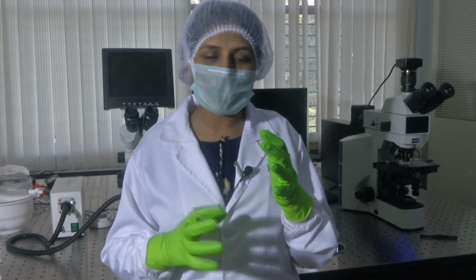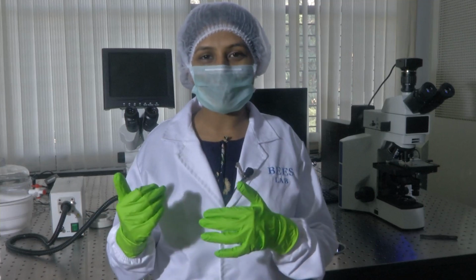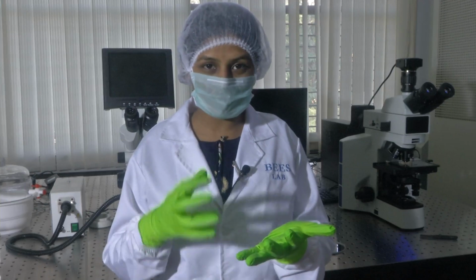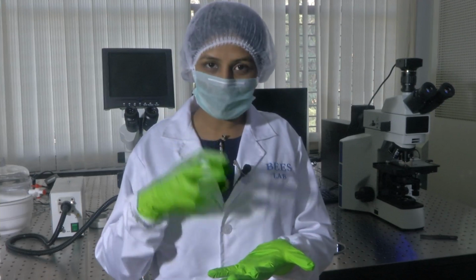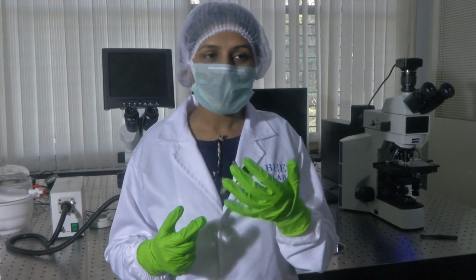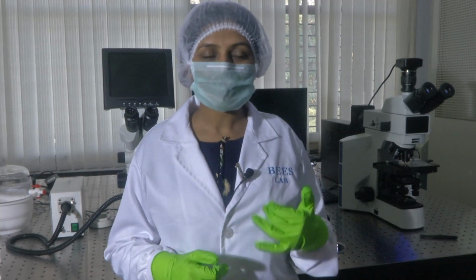So the compound microscope has a high magnification power. But when you compare it with the stereo microscope, which we would be using, the stereo microscope has less magnification. However, its feature is that it gives a depth perception of the object you are looking at. This 3D image, or depth perception ability, of a stereo microscope has been leveraged for our case, where we have microfluidic devices or chips, or in some cases even an entire dissected tissue. Huge samples on a macro scale can be studied using a stereo microscope.